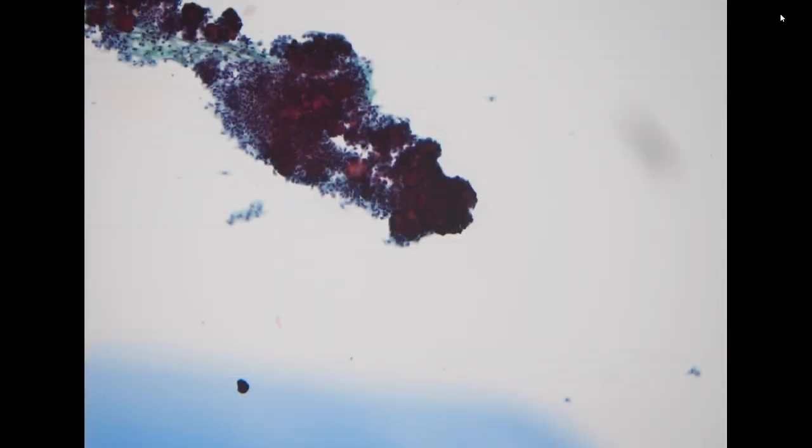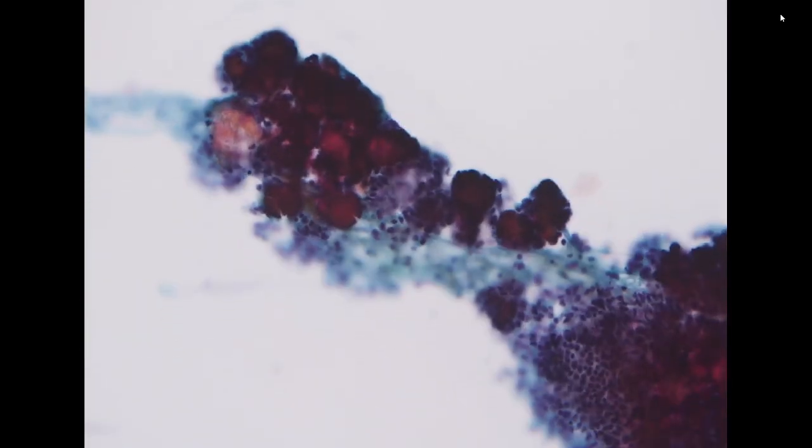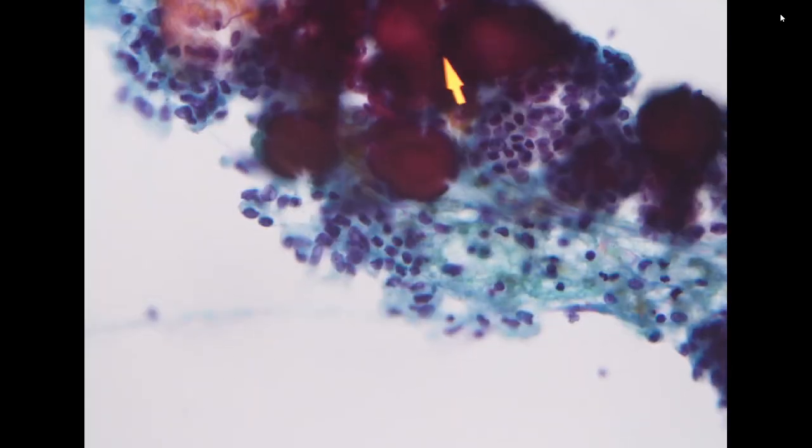So the next specimen is from a peritoneal washing in a patient with ovarian cancer receiving debulking surgery. The specimen itself is not well preserved. The cell morphology is not well preserved. It's very dry. However, you can see there are a lot of psammomatous calcifications. So this is a specimen with abundant psammomatous calcification.